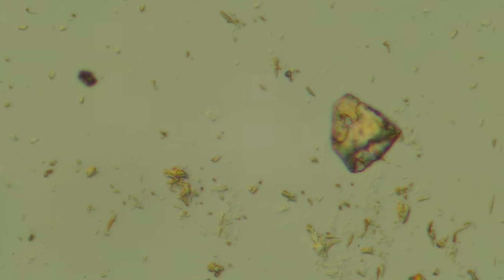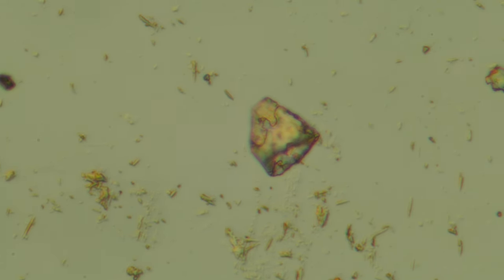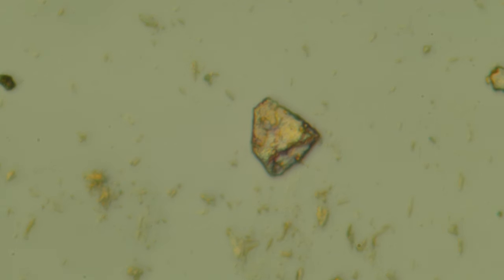Yeah, so here it is with that projection eyepiece in there, and I just cleaned it, so maybe it's doing better. But yeah, hard to say. Focusing carefully through it. So I'm interested to hear what you guys think. You can see it's actually flipped vertically. What's up is down, what's down is up when I put in that projection eyepiece.